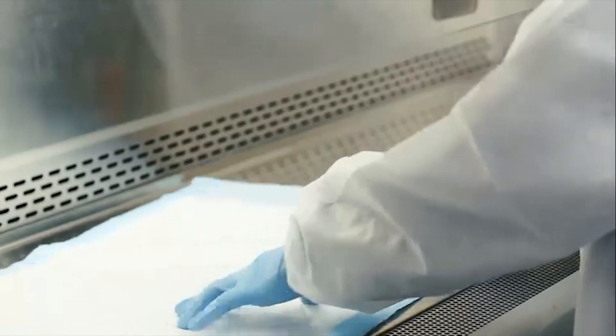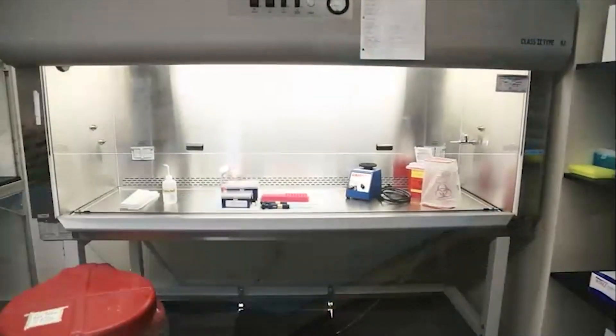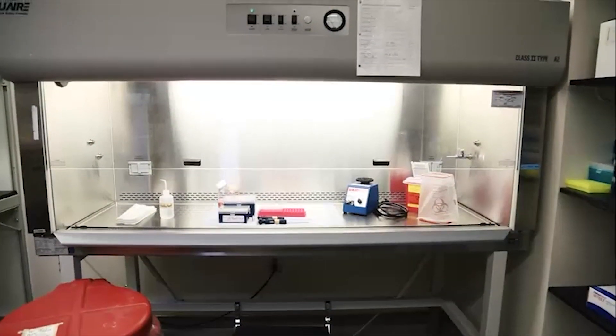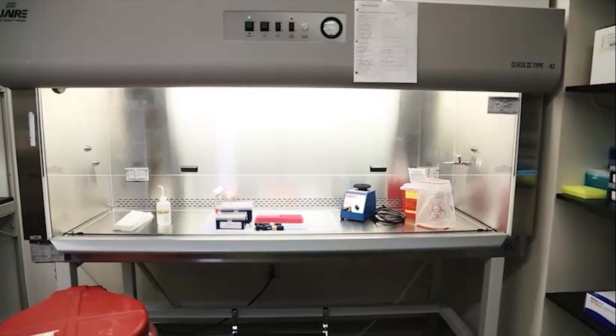The primary plating step, as well as making a direct smear from a specimen, is performed in the biological safety cabinet.